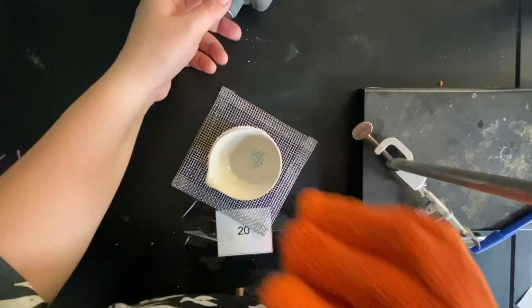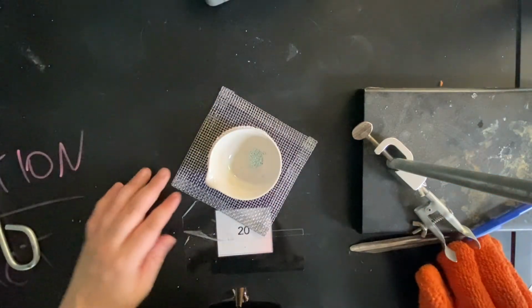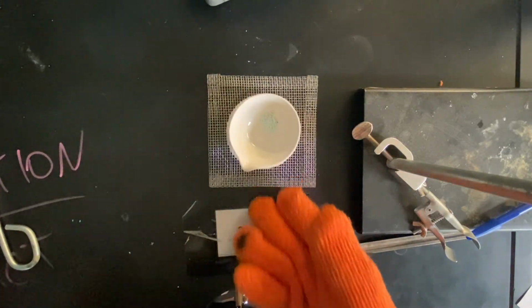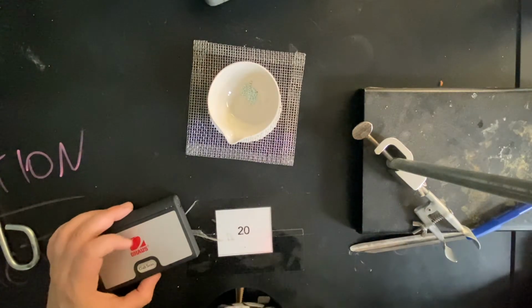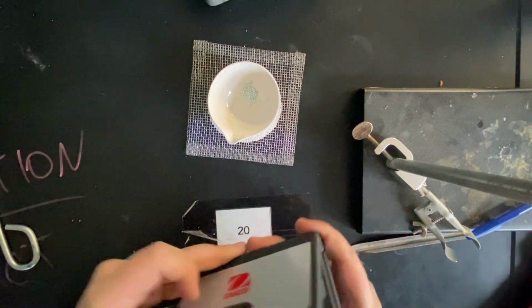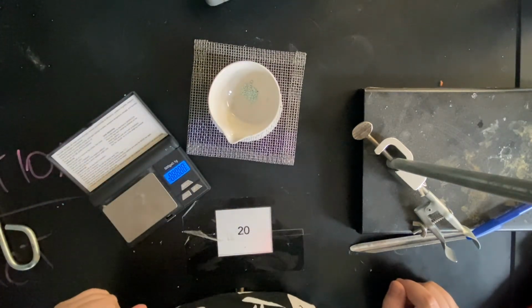Once that is cool, and at this point you can turn off your hot plate, unplug it. We're going to let it cool for a few minutes so it is touchable. Do not move it, let it cool. Do some calculations that need to be done on your sheet. Once this cools about 5 minutes, you're going to reopen up your scale, and we're going to take the mass of the cool crucible.